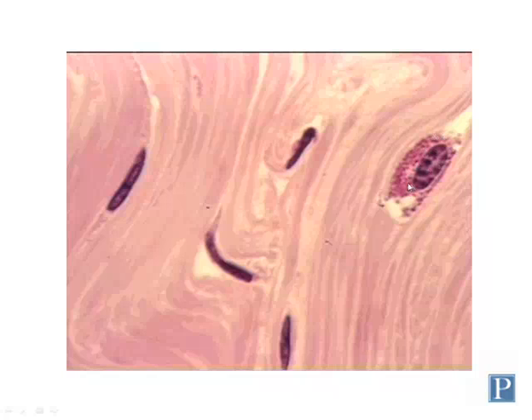These granules contain histamine and other mediators of inflammation, so these cells help to regulate an inflammatory response to tissue injury or infection. These other cells, as we said, are fibroblasts, and again, mostly their nuclei are visible.